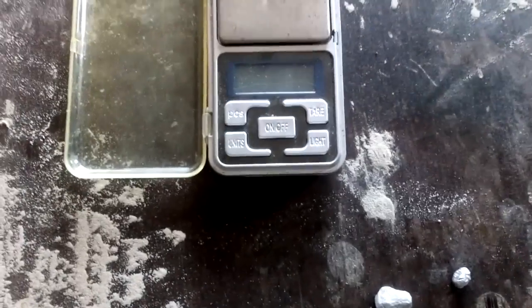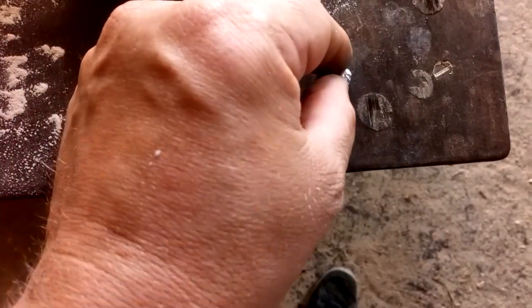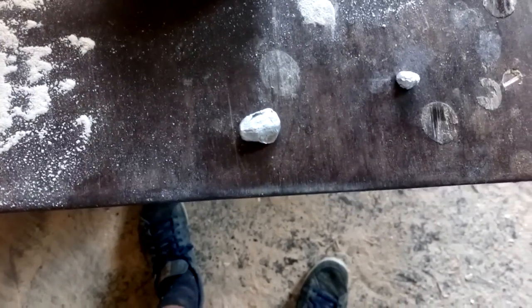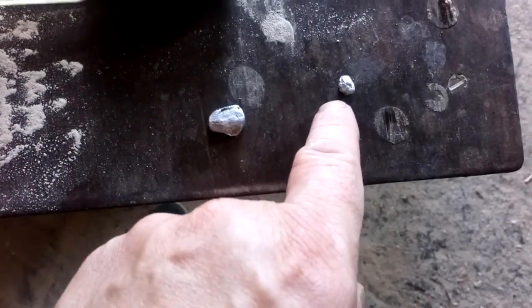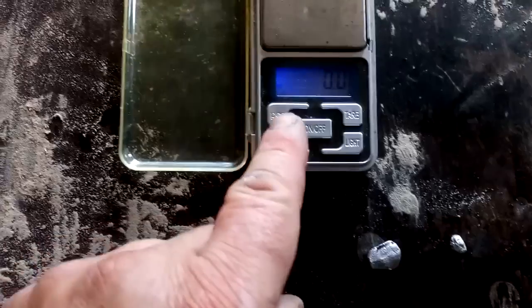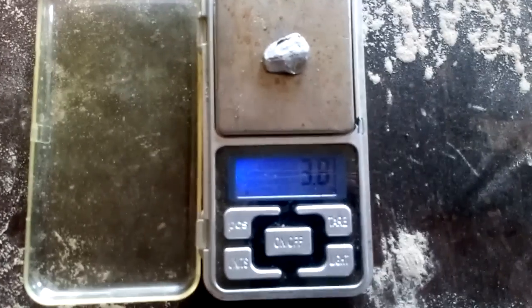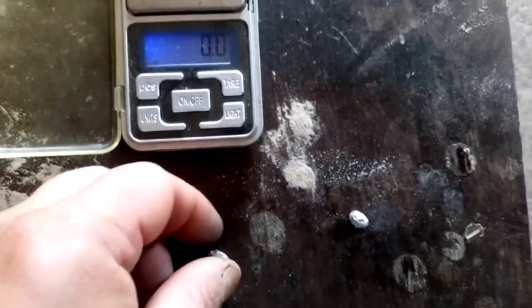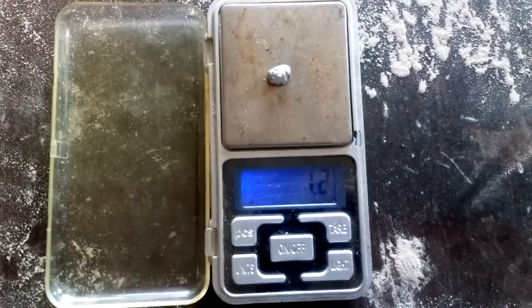It's time to measure our results. Here is our little two beads — we got this little bead of silver, and we got this nice little bead of palladium after melting. They actually look very similar. When palladium was discovered, somebody said it was the same metal as silver because it looks pretty similar — but they're not. We got 3.8 grams of silver and 1.2 grams of palladium. Not bad!